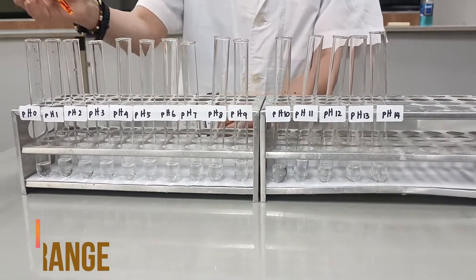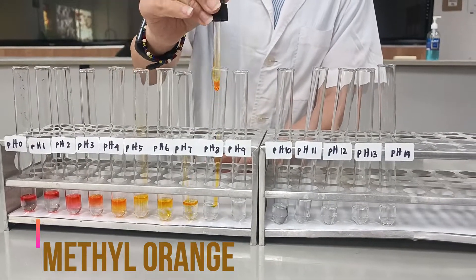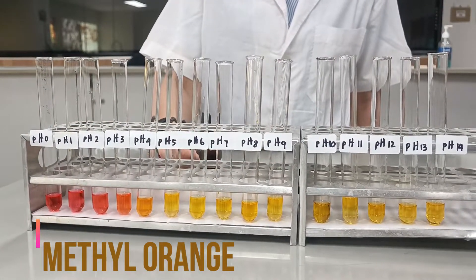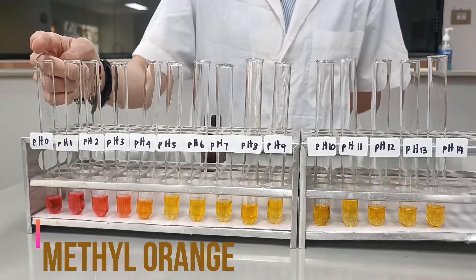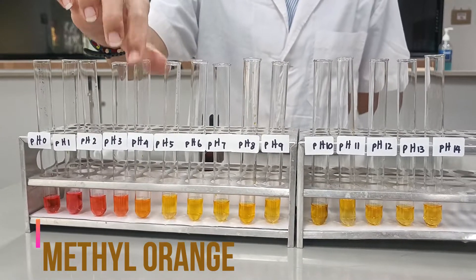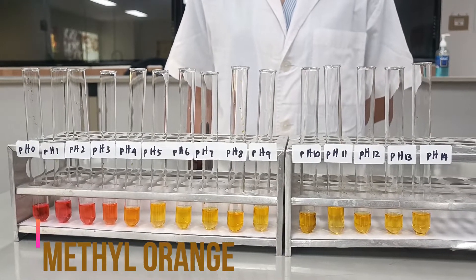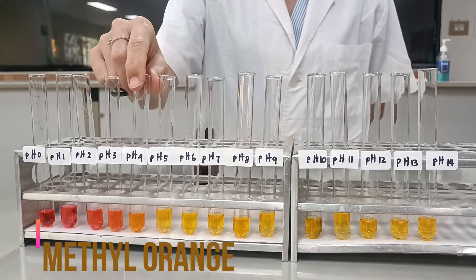The first one that we are going to take a look at is methyl orange. I'm going to put about two drops to each of these. As you can see, there are three different colors that methyl orange shows. It starts from red or pink color at very low pH and it turns to orange color at pH 3 or 4, and then it continues on to show yellow color. Because methyl orange pH range is from 3 to 4, it is suitable to be used in titrations that have an acidic equivalence point. When you titrate, you should stop titrating when you reach an orange color like these two.